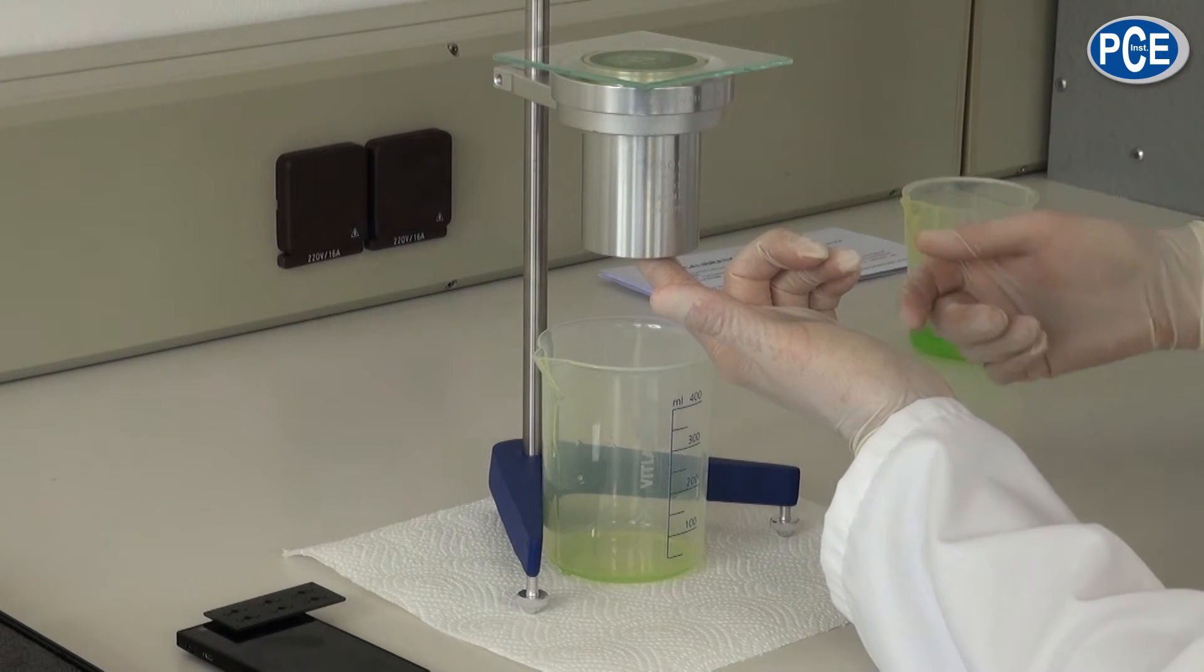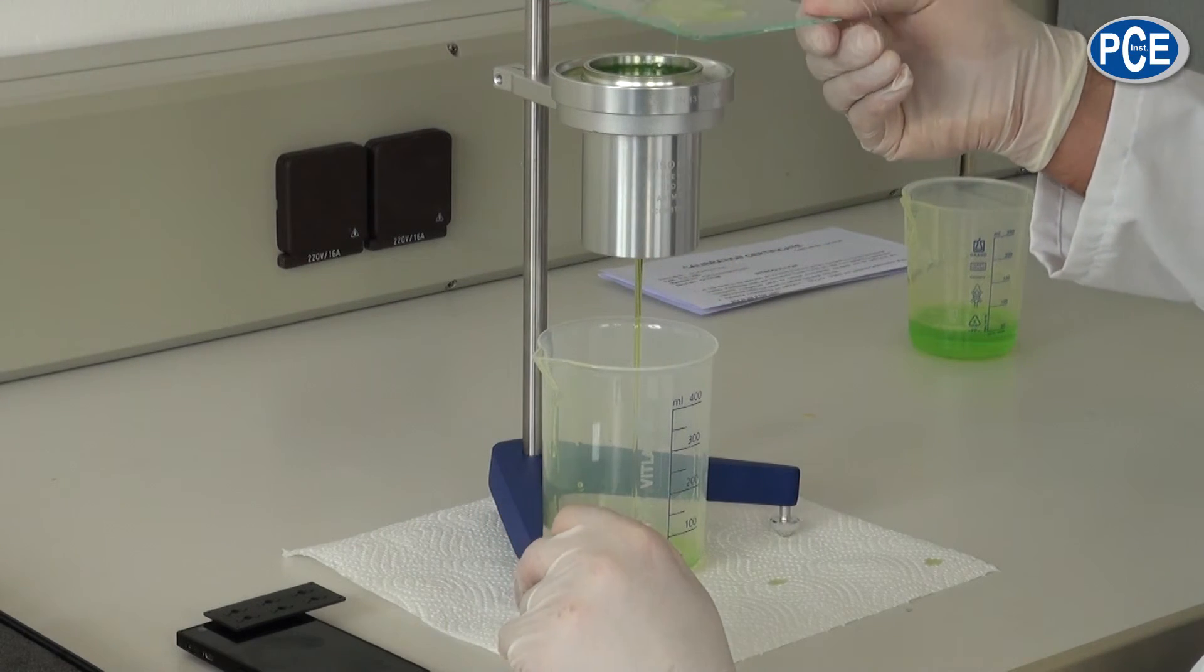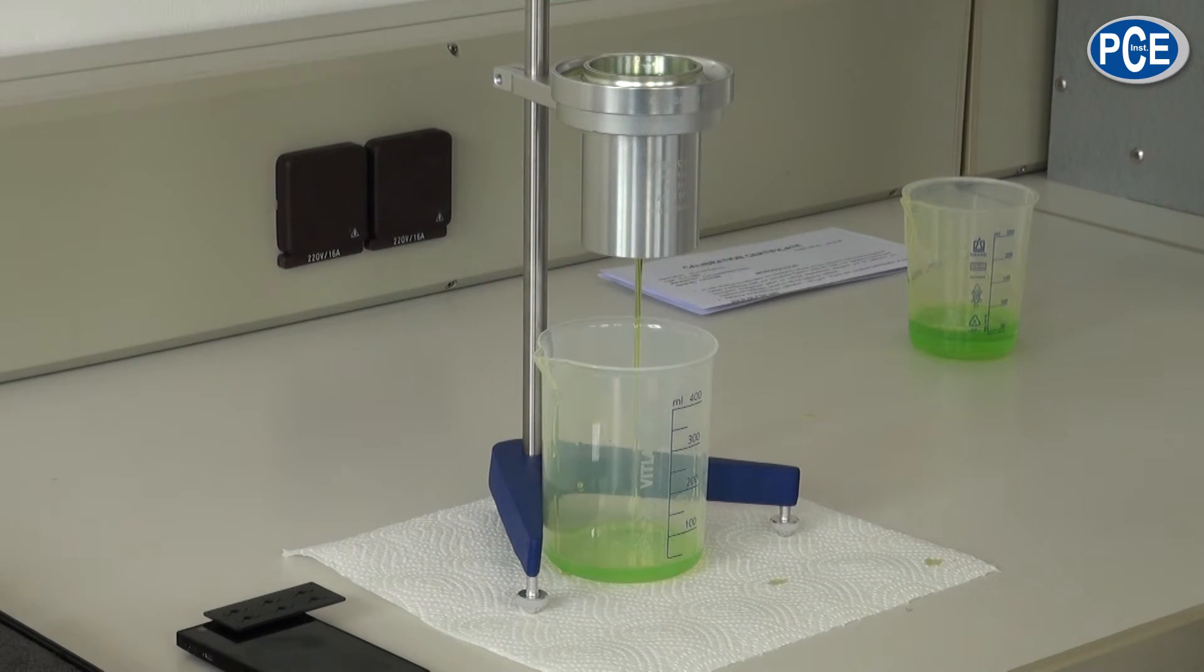Then the nozzle is opened, the glass plate is removed, and the measurement can begin. Here the time is stopped to measure how long the fluid needs to flow out of the cup.